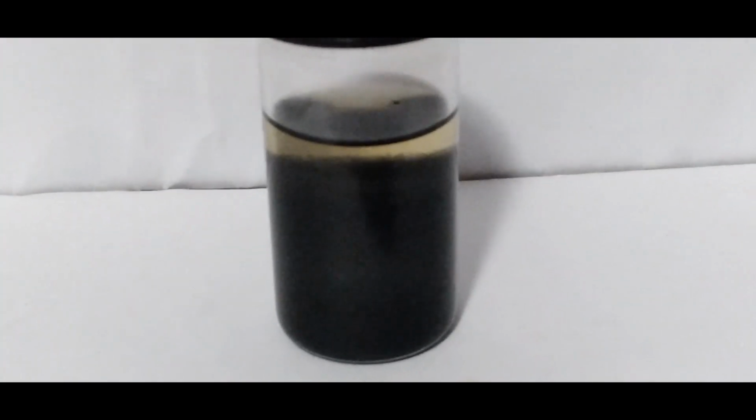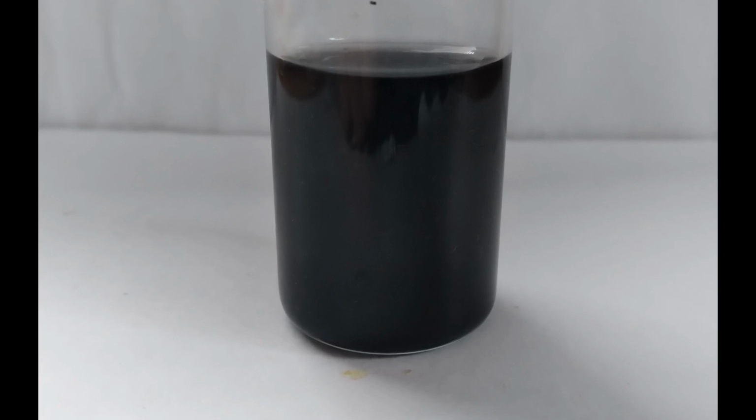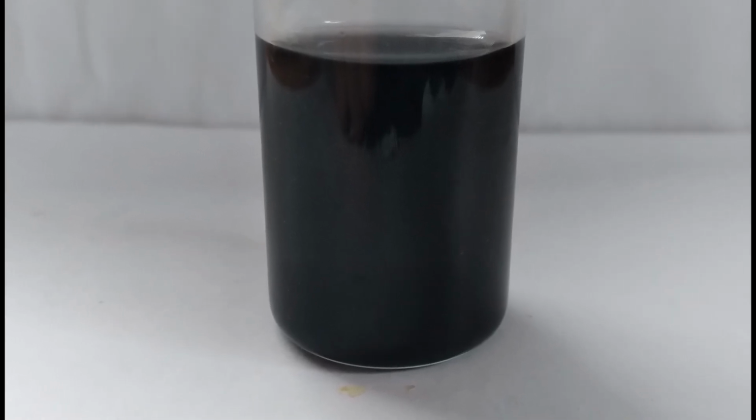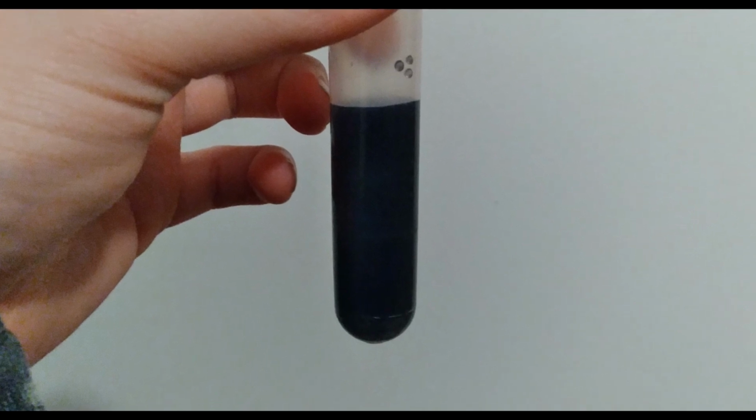What you see before you is a mixture of osmium dioxide and magnesium hydroxide. I previously tried to separate them by dissolving the magnesium hydroxide in citric acid. However, this produced a colloid of osmium dioxide so fine that my centrifuge could not spin fast enough to separate it out. So, I have to oxidize the osmium to permanently separate them.